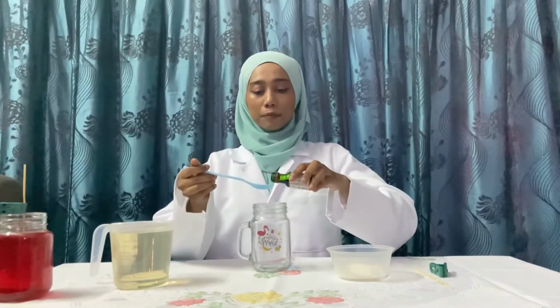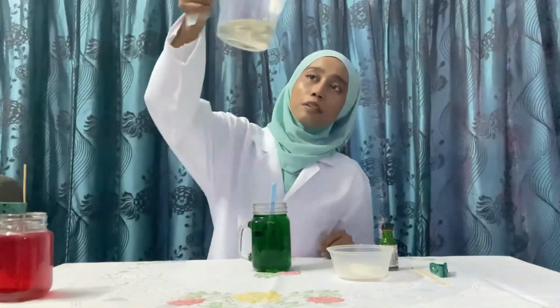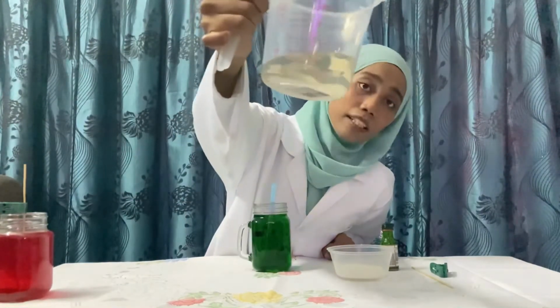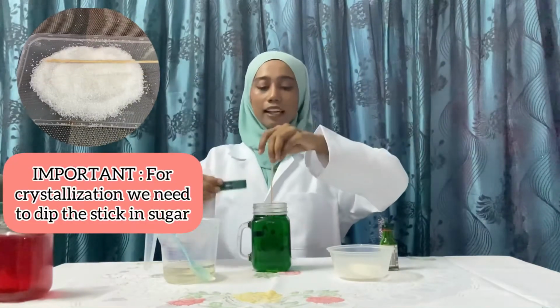So now we will continue with the second experiment, sugar crystallization. I also use 400 ml of hot water. Add sugar to the hot water and dissolve it. This procedure is the same as the salt crystallization. Our solution. If you can see, there's remaining sugar that didn't dissolve in the solution. Okay, I use this stick and clip. So this is the salt crystallization and this one is the sugar crystallization.